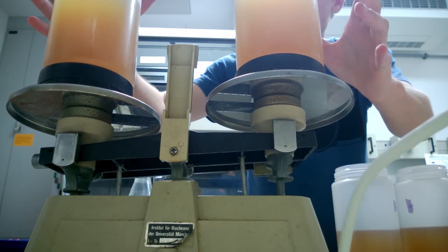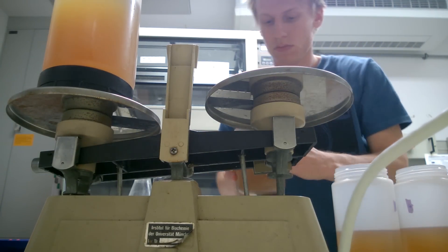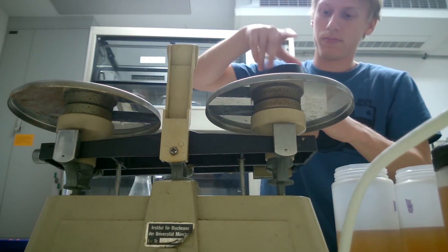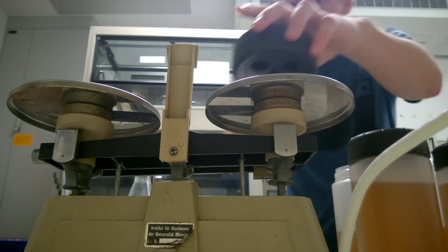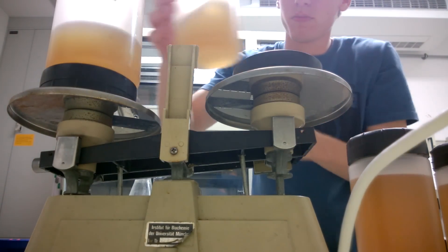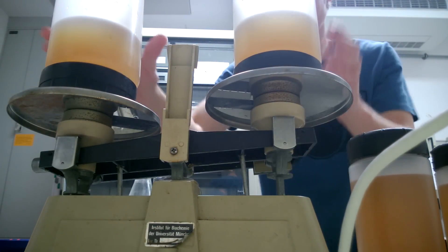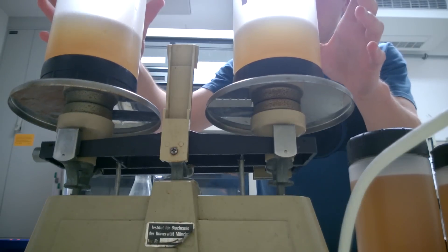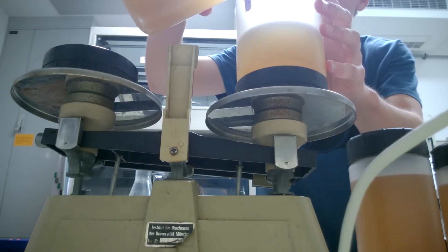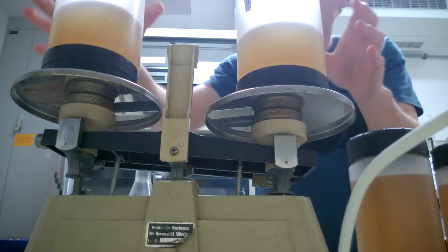It's not going quite all the way down and it's not resting, so that's fine. It doesn't have to be really exact because it's only going up to 4000 G. We have ultracentrifuges that go up to several tens of thousands of RPMs, and for those you have to be exact to the milligram. For this one it should still be balanced out really really well. Oh, that was too much — I gotta pour some back. Still too much. Sometimes you get it right first try and it makes you feel like a badass, but then sometimes you have to pour over and over — and finally I got it.